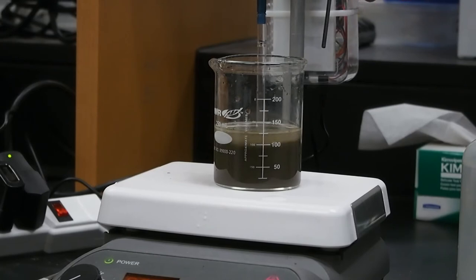Generally it would take me about five minutes to stir up the entire sediment so that they become nicely suspended, as you can see here.